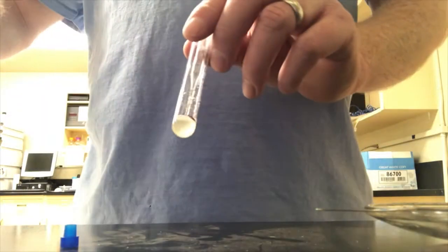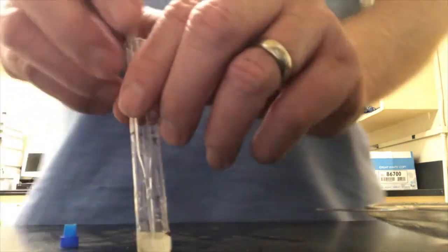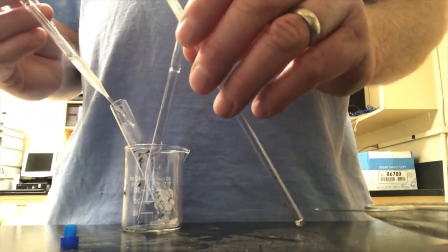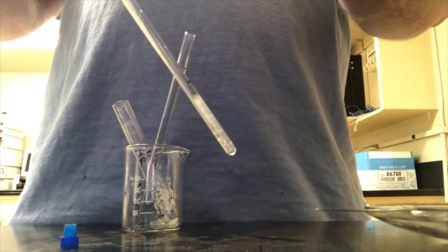So this was effective. I only had to add 6 drops of deuterated DMSO. I didn't have to add the whole half centimeter worth. And now I will add it back to my NMR tube. And when I do it, I actually like to get a little bit of solid into the NMR tube, if it's possible. I don't mind a little bit of undissolved solid in the NMR tube, actually. It's fine, and it lets you know that you're saturated.